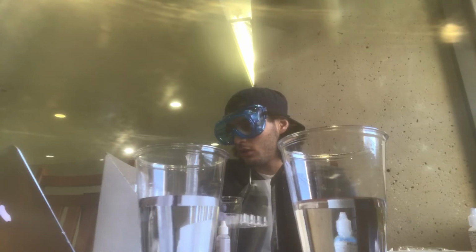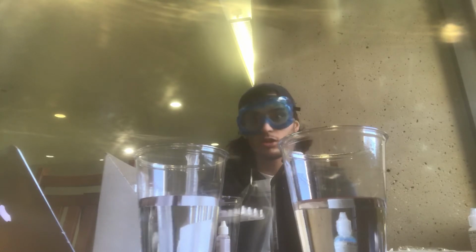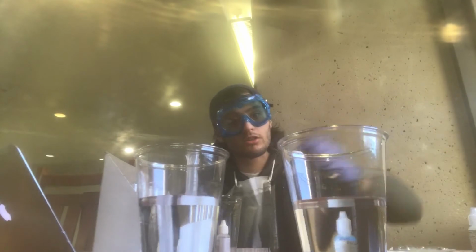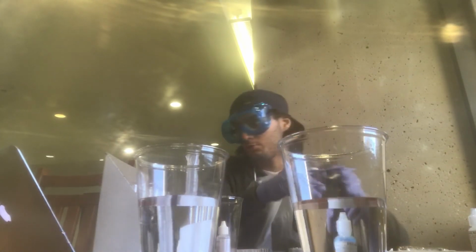Okay. So now we're going to mix it a little longer. And now I'm going to get the syringe. And we're supposed to get 0.4 of the hydrogen peroxide.